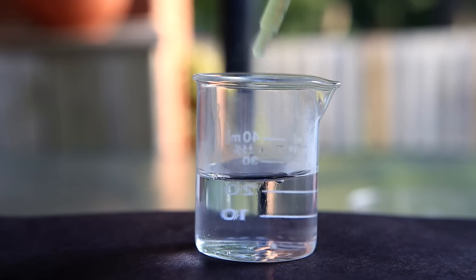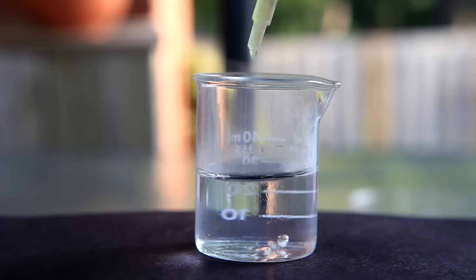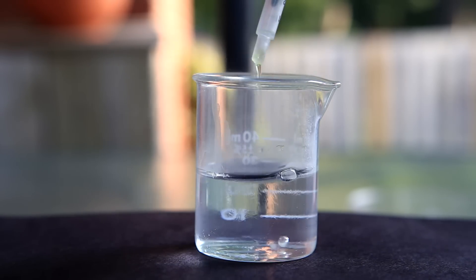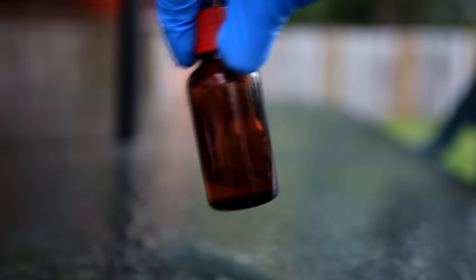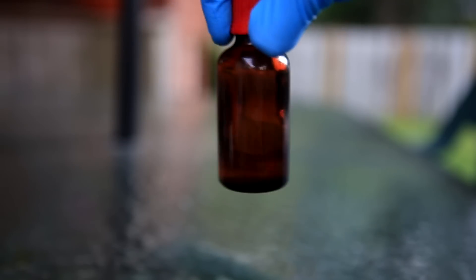I'm interested in making silicon tetrachloride because I find it interesting that it's a liquid, but when exposed to moisture it reacts to form silicon dioxide, also known as sand. I thought that this might be interesting so I decided to give it a try.